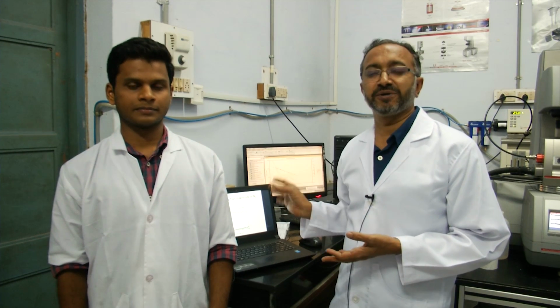So in this example, we saw how normal stress difference is measured, and when we do the steady shear measurements, we can do both the shear stress measurement, which is based on the torque measurement, and the normal stress measurement, which is based on the thrust measurement. And in this particular example, we saw that the sample generates a negative first normal stress difference, and this is in fact one of the unique materials which gives a negative normal stress difference.